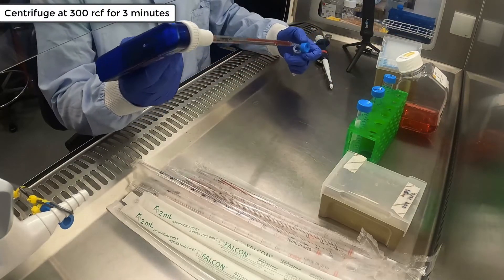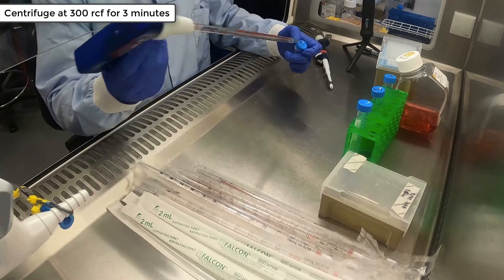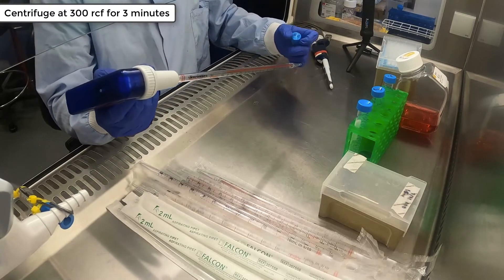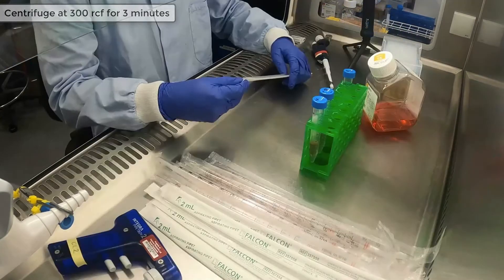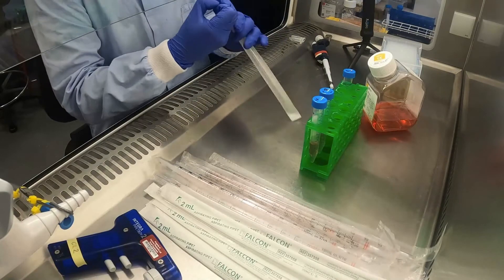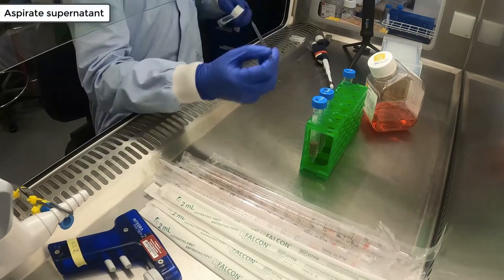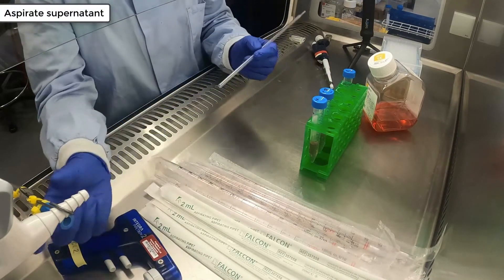Then centrifuge both tubes at 300 RCF for 3 minutes. After centrifuging, aspirate the supernatant from each of the tubes.